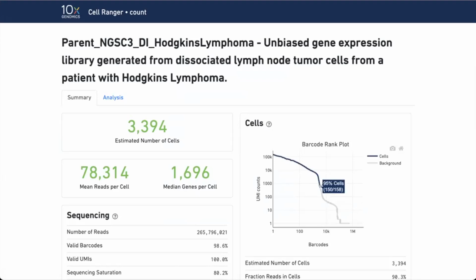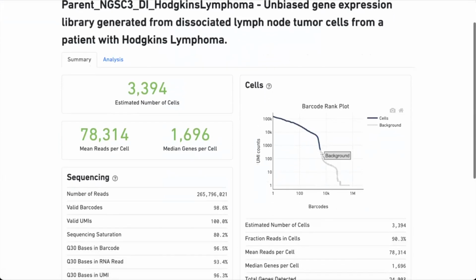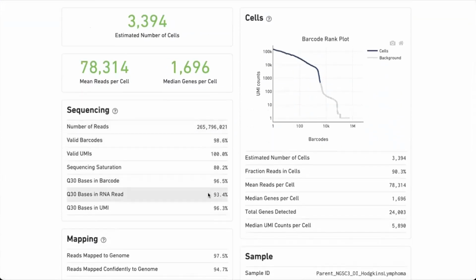So here is one example of one of these barcode rank plots. If you ran 10x experiments, you probably saw them. It just defines the inflection point here. You get some stats like number of cells, reads per cell, mapping stats. I think it's important to look at sequencing saturation, for instance, because, like we talked about with Henrik also, the amount of cells you load versus how much sequencing you get per cell, you can get a good feeling for with this.